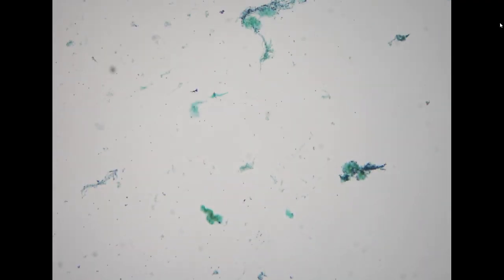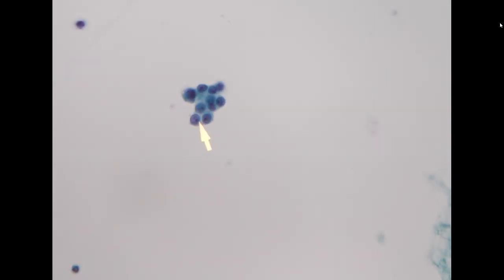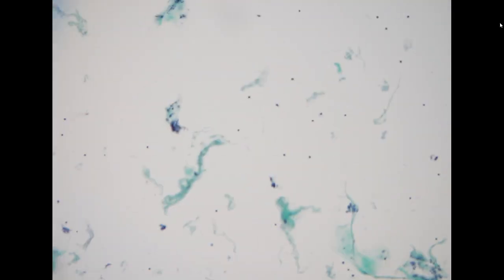The next specimen is a breast aspiration. The patient has a prior history of invasive ductal carcinoma with mastectomy. The clinician identified a nodular lesion on the scar of the operation site. This is a small nodular lesion, but you can see here are some atypical cells in clusters with prominent nucleoli and small cell nests. The cellular component is not very apparent because there are a lot of inflammatory cells in the background.